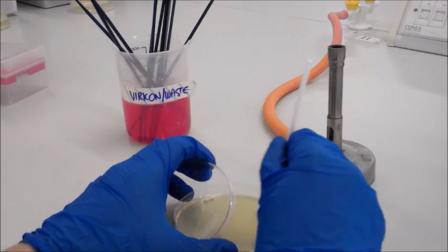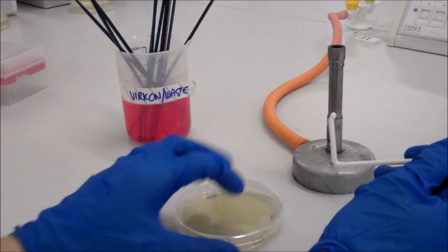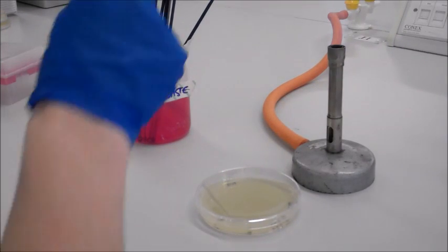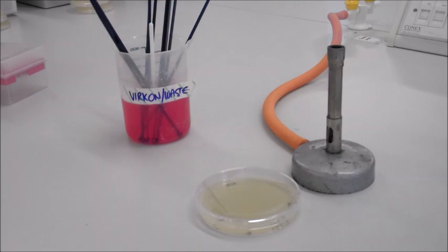When you start to feel slight resistance during spreading, you can stop, as this indicates that the culture has sufficiently absorbed into the agar. Once you have finished spreading, place the spreader into the beaker of Virkon on the bench. So that's how you make a spread plate using E. coli. If you remember the key points, such as keeping close to the Bunsen flame and not talking while plating up, you shouldn't have any problems.